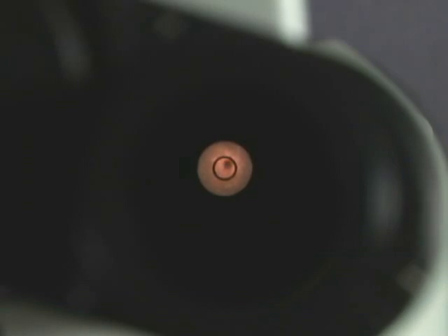Then do the other side. And what we want to do is we want to put the little dot right in the middle of the circle. When the dot is right in the middle of the circle, we basically should have perfect phase contrast adjustment.